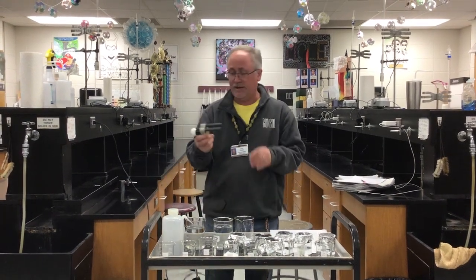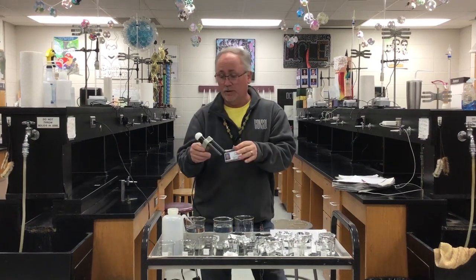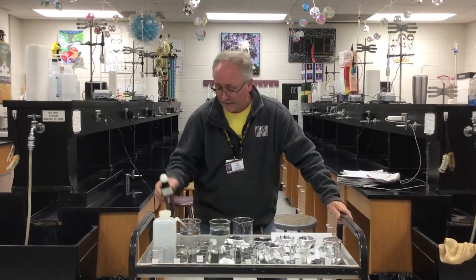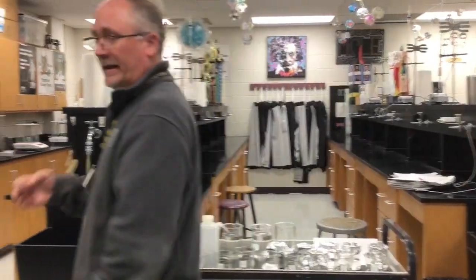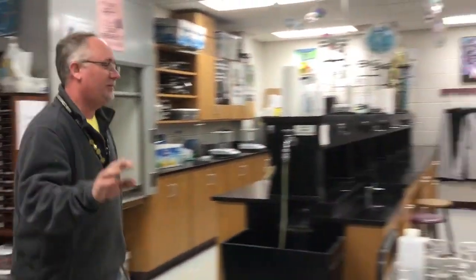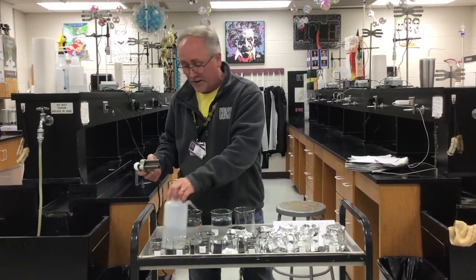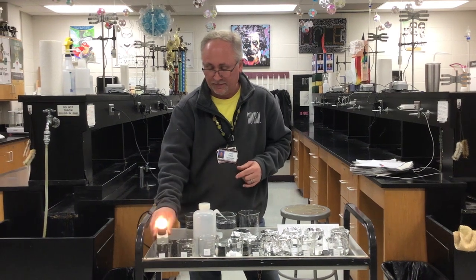And what I'm going to do is take a conductivity probe that, when I place it in the solution, will light up when I have an electrolyte present. I'm going to leave the lights on for now, and if we have some that are really dim, maybe we can zoom in or turn the lights off at that time. We'll see how it goes. So 5% NaCl solution. I'm going to place it in the solution, and you're going to watch it and tell me what happens.